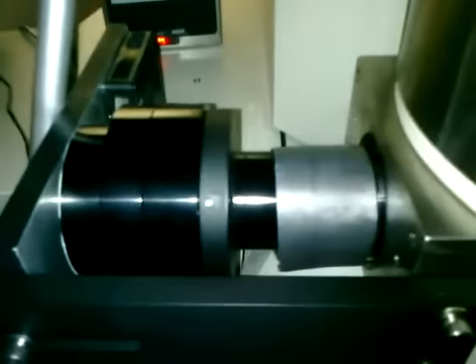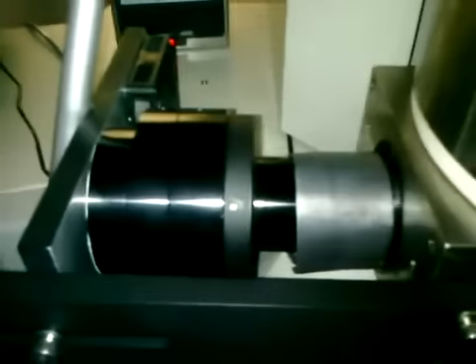Okay, now, when we analyze asbestos, the first thing we do is we see it here. And then we have to determine its morphology is correct. In this case it is, and we have to determine its chemistry is correct, in which case it is. We'll just have to take that as an assumption right now because I'm not going to pull a spectrum. But the next thing we have to do is take a picture of its diffraction. That's its crystal makeup. And that is accomplished with this camera right here. And you can see the lead shielding there. This camera is linked to this computer here.